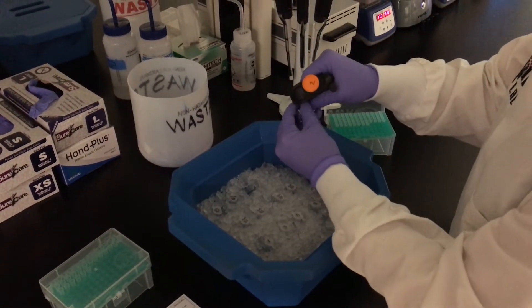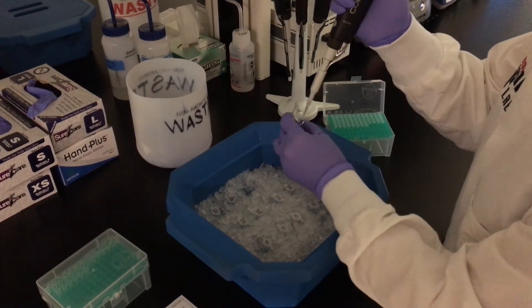Silver nitrate is a light sensitive material. Lights in the lab are kept off when it is added to the samples.